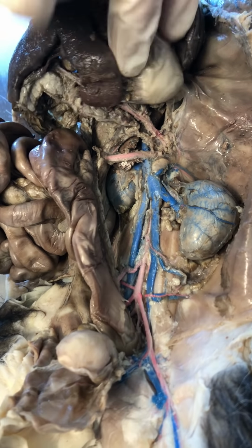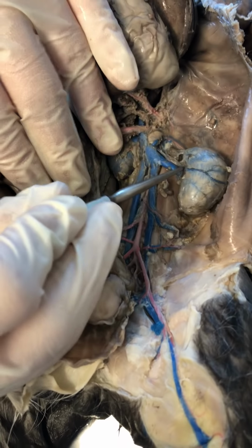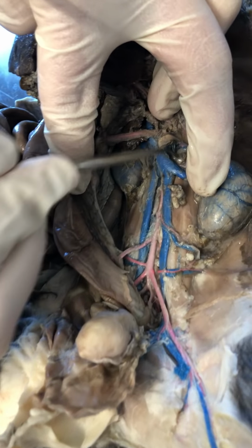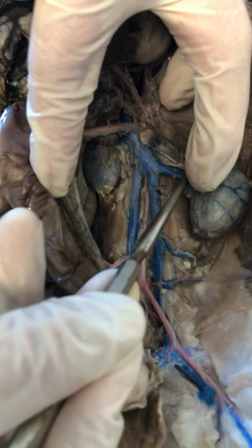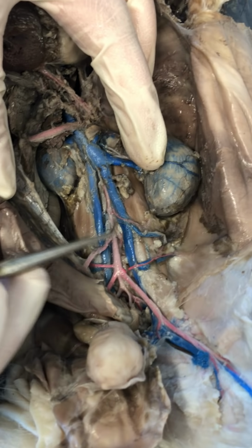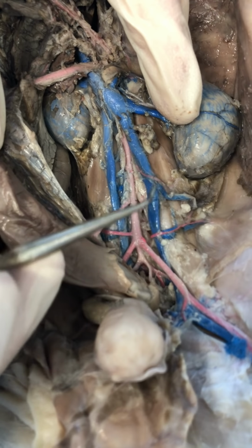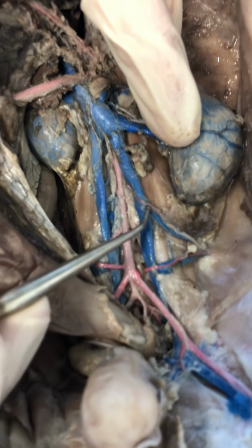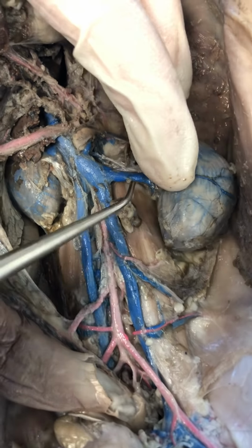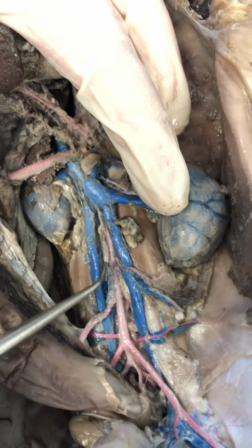artery. Okay. So just below that will be my renals. Okay, so there's an artery in here somewhere. It's back there underneath the vein. Okay. Right there, going to my kidney, that's my renal artery. Okay. Just below that, if we find this real tiny, see this little string-like artery, real tiny right there? That's my gonadal, okay? So underneath my renals, there will be a gonadal on either side.